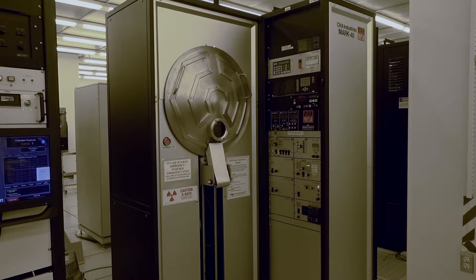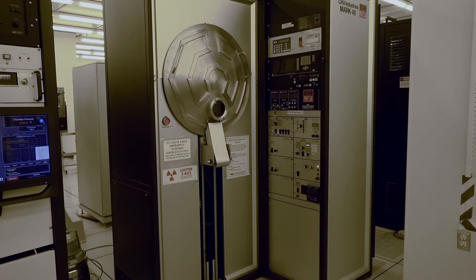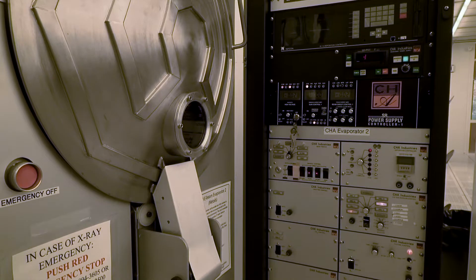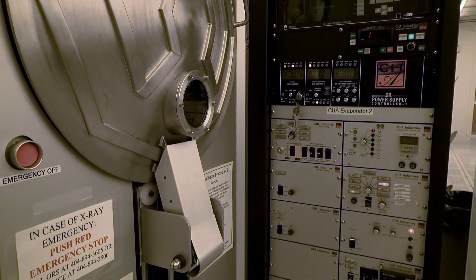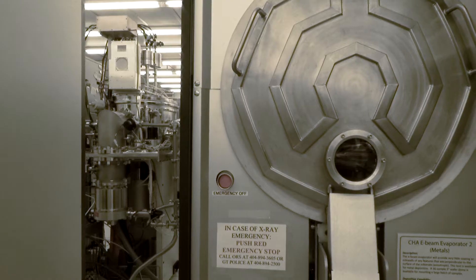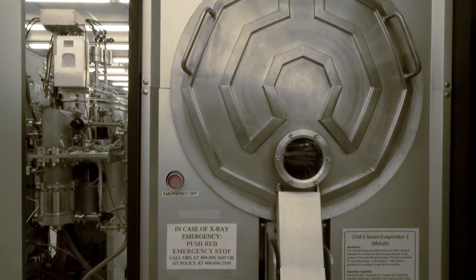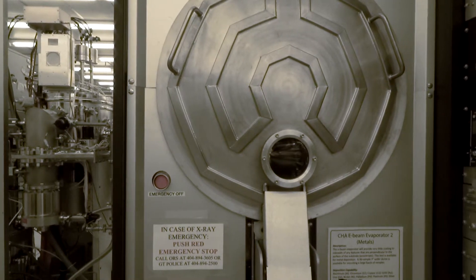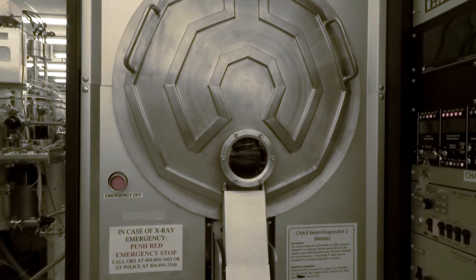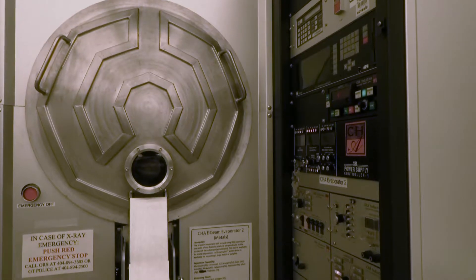The CHA Mark 40 Electron Beam Evaporator is used to coat samples with various metals. During a process, a high-intensity beam of electrons is focused on the center of a crucible containing a specified source metal. The energy from the electron beam causes the source metal to evaporate, which then coats the surface of a sample with a thin layer.